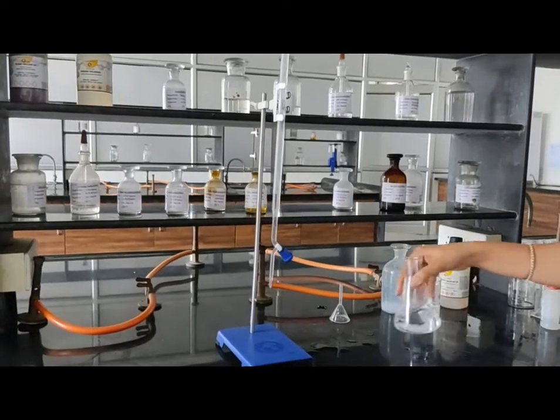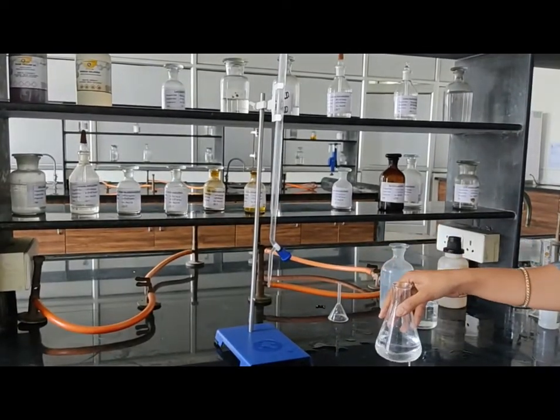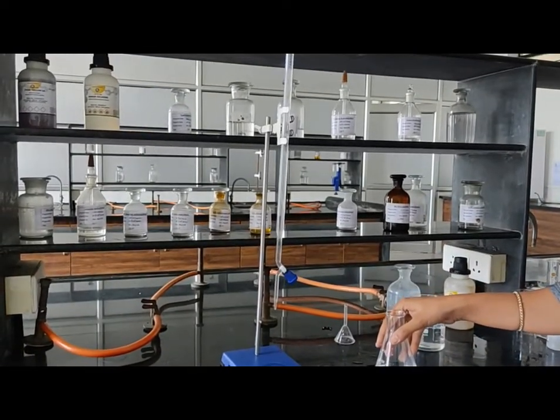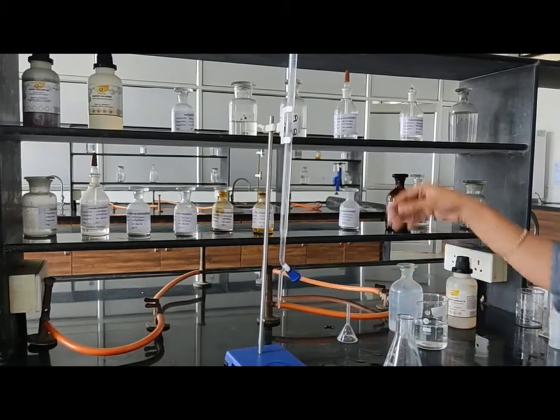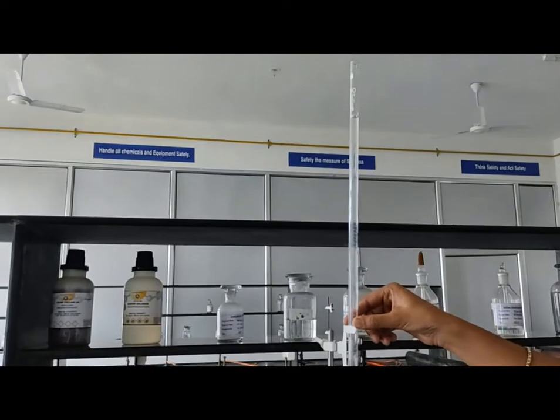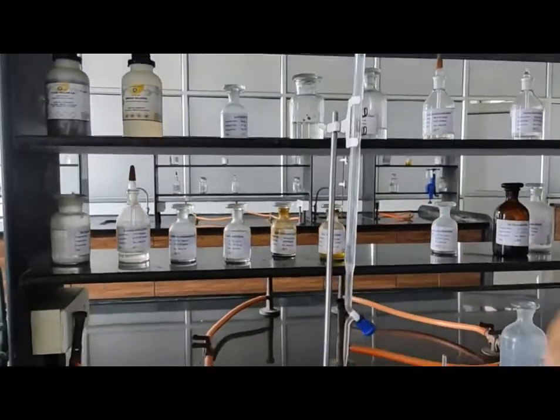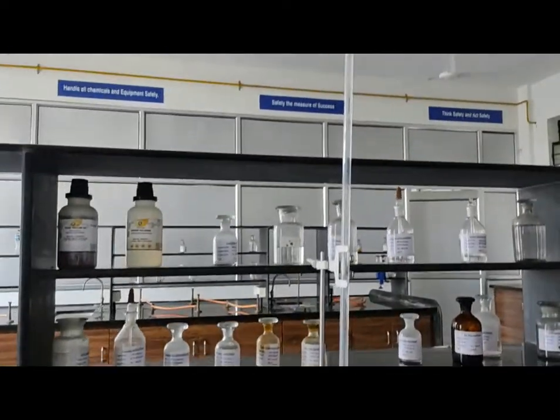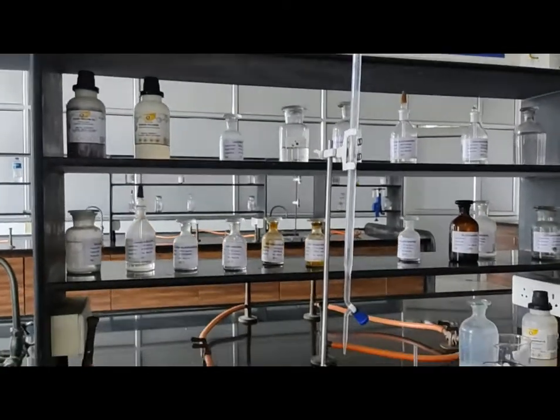Now this solution we have to titrate with 1 molar sodium hydroxide solution. For that, in this burette we already filled 1 molar sodium hydroxide and adjusted to zero level. So let's start with titration.